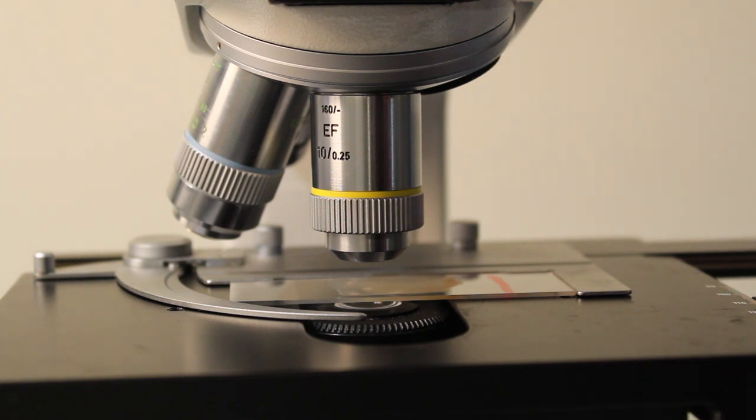In all likelihood, you're going to want a higher magnification image than the one you can get with your lowest magnification lens. The good news is that you don't have to go through this whole focusing process with every lens.